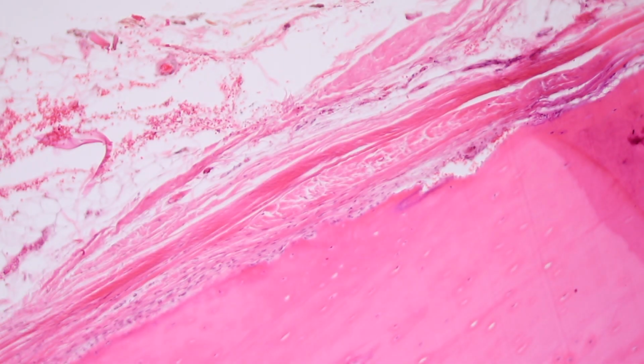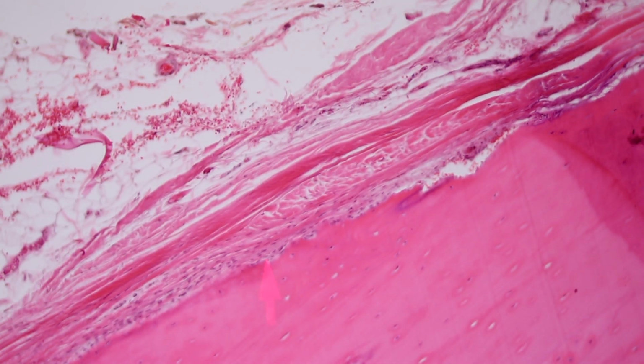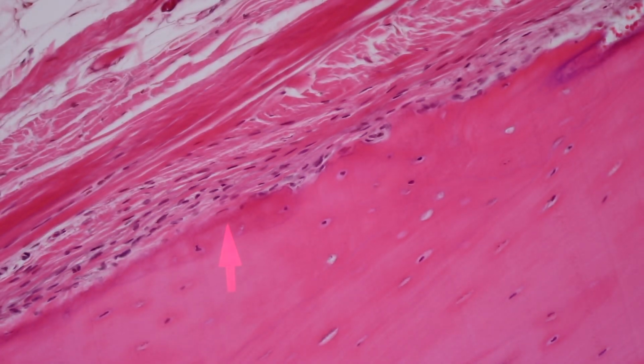And I will point out two layers of the periosteum. We have an outer layer, the fibrous layer, that forms a structural role, helps supporting the periosteum, and then the inner cambium layer of the periosteum. You can see from here to the bone-forming surface to the fibrous layer, it's more cellular. And it's within those cells that resides the mesenchymal stem cells that are going to give rise to osteoblasts to produce more bone.